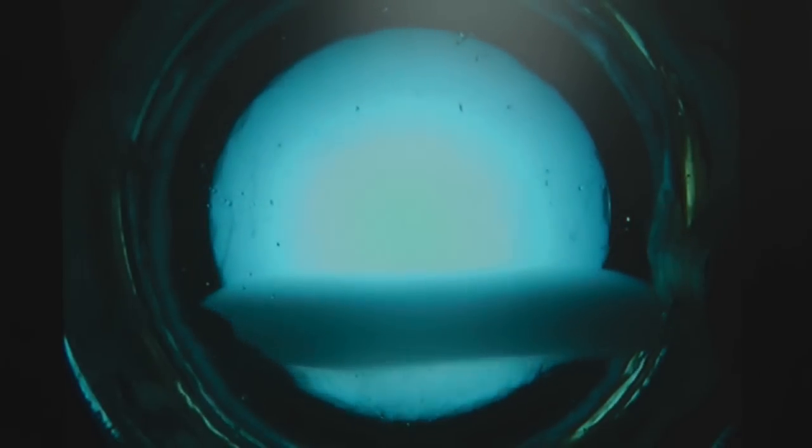There we go. You can see we get this fantastic snowstorm effect, where the gas comes out of the solution and rises to the top, and we get droplets of the liquid forming, which fall to the bottom.